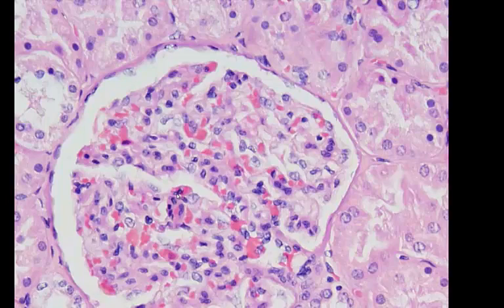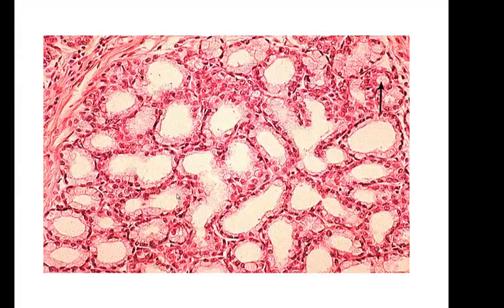So those are examples of simple squamous inside the lung and inside the kidney. The job of simple squamous would be diffusion or filtration. Our locations would be the kidney and the lung. There are other locations in the body, but those are the easiest. Now in this slide, you see these regions here, here, just about everywhere.